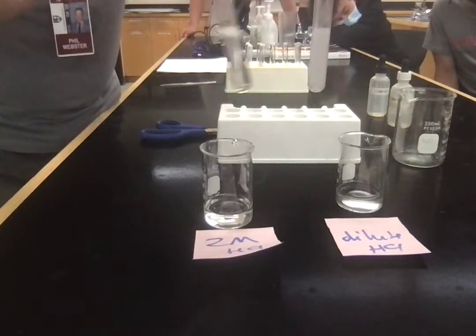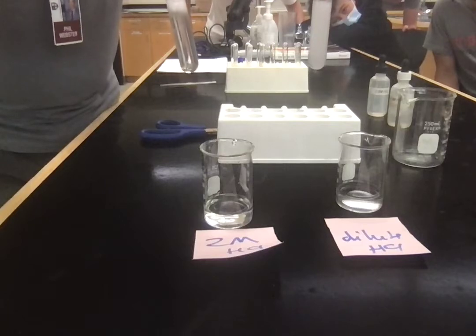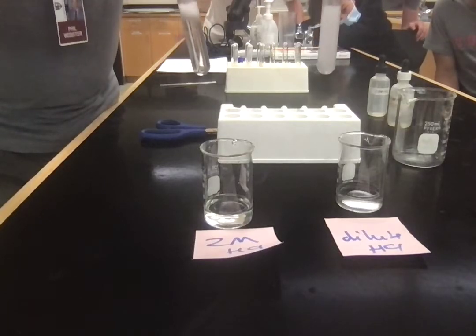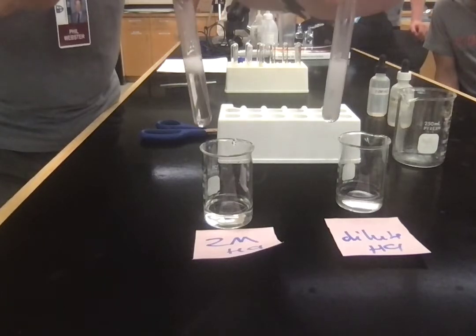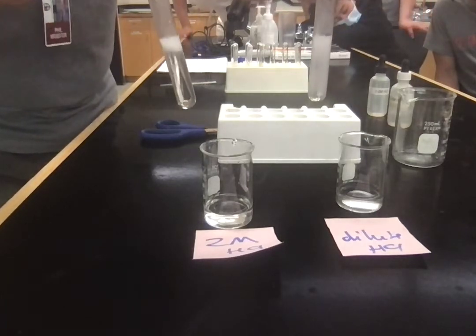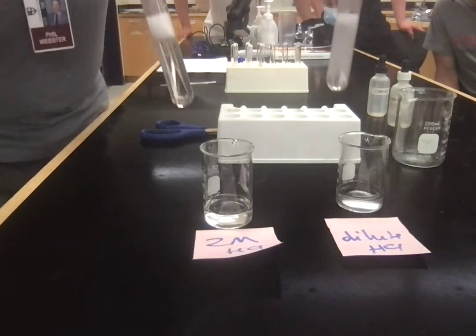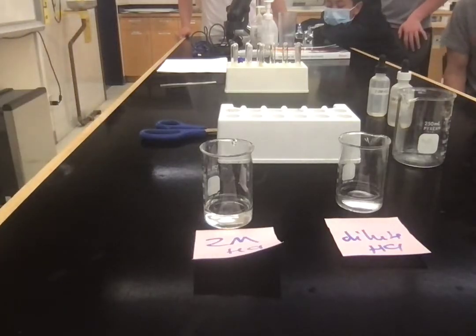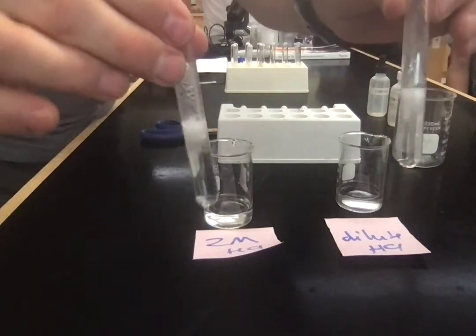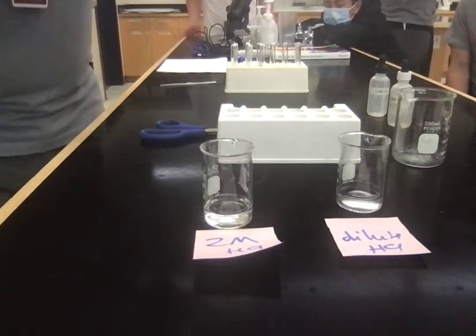Concentrated. What's happened there? It dropped down because it doesn't have as many bubbles on it. This one, there are so many bubbles stuck to it and then escaping that it floats. Whereas this one, not as many. Touch and compare. Oh, that one's a lot more. Nick has said that this one, which is the 2M, is a lot hotter than this one.